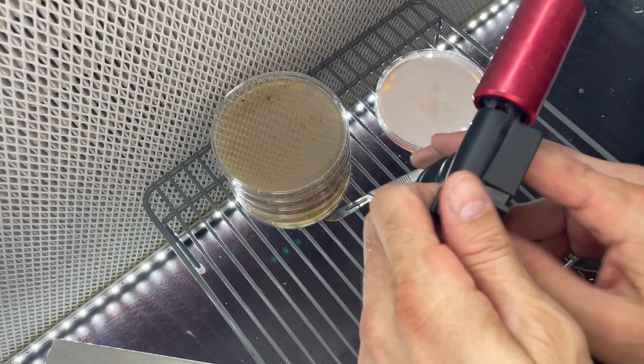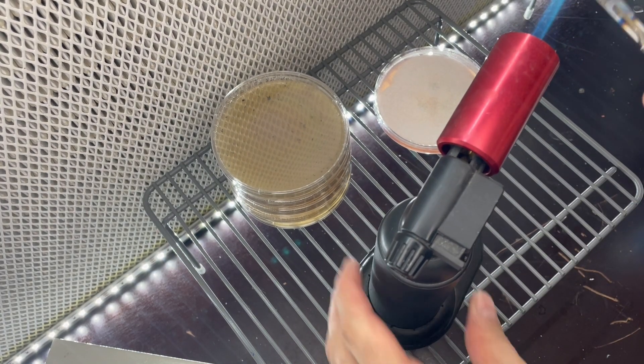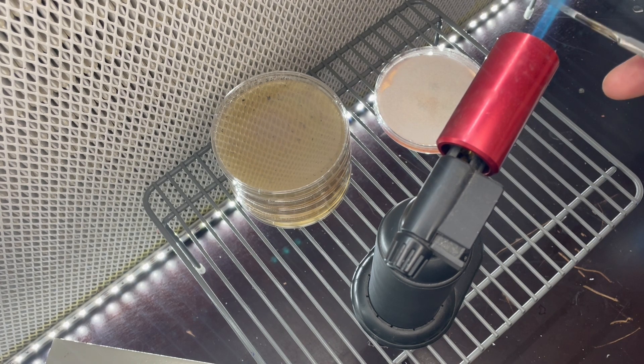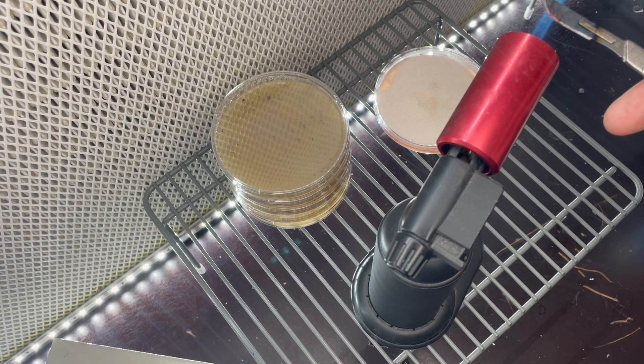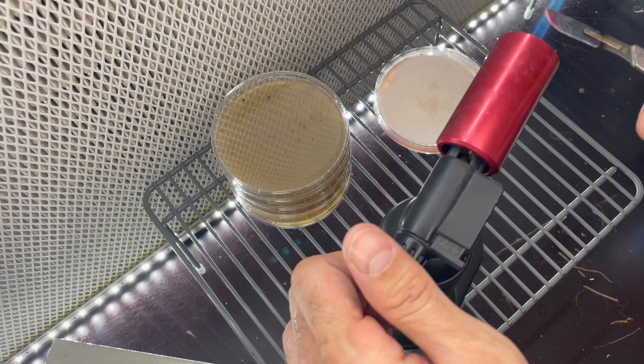So first things first, we're going to take our scalpel with a torch. You can use an induction heater, induction heaters are great. I just currently don't use one. I seem to like a torch, but induction heaters are great as well to sterilize tools.